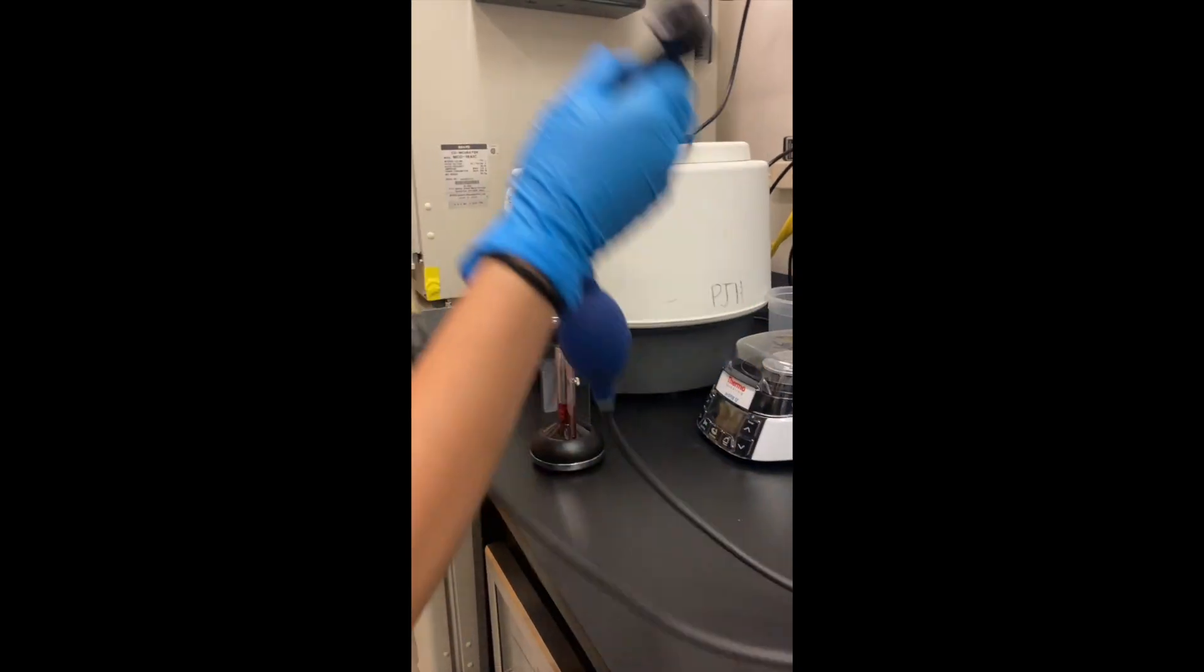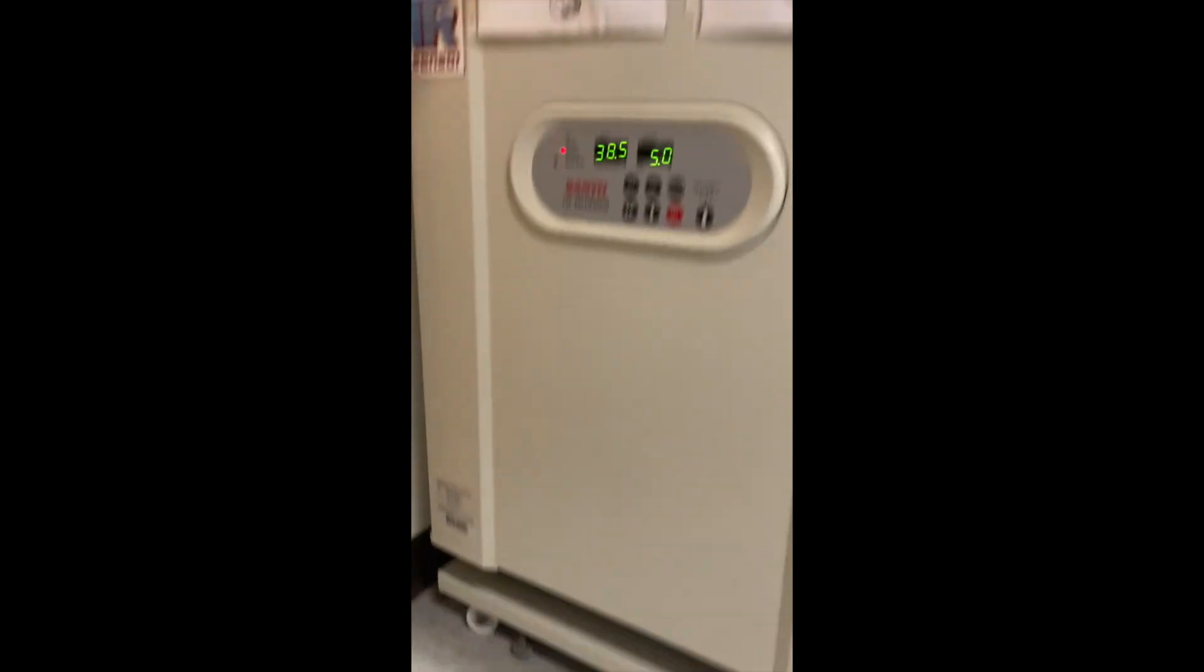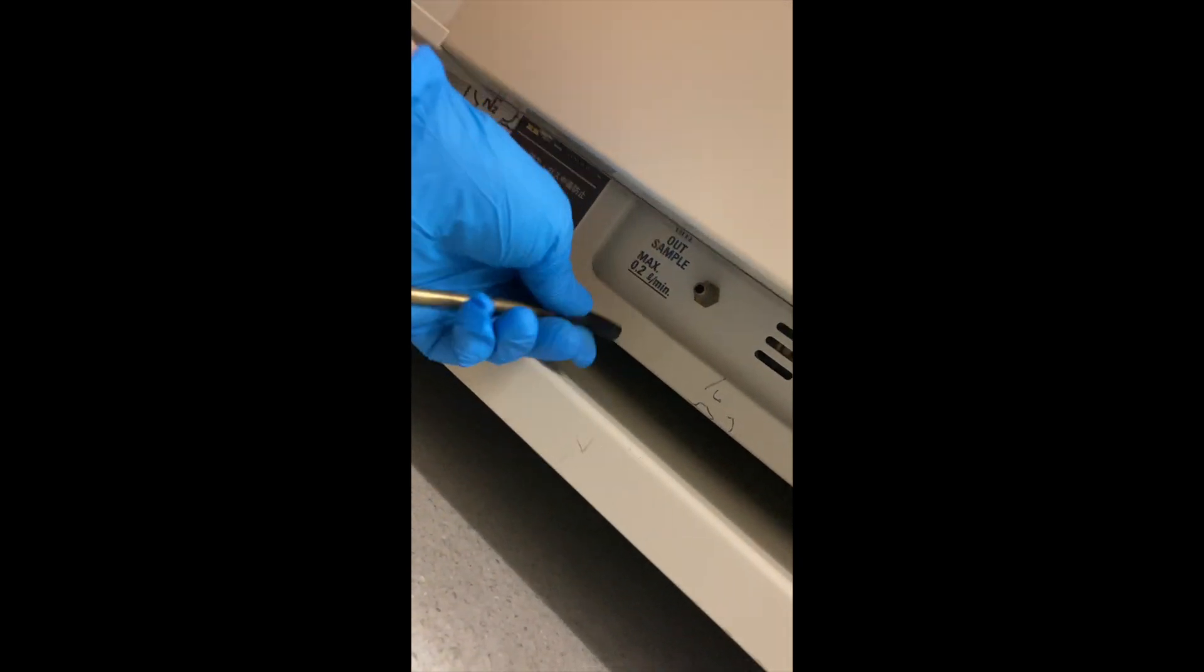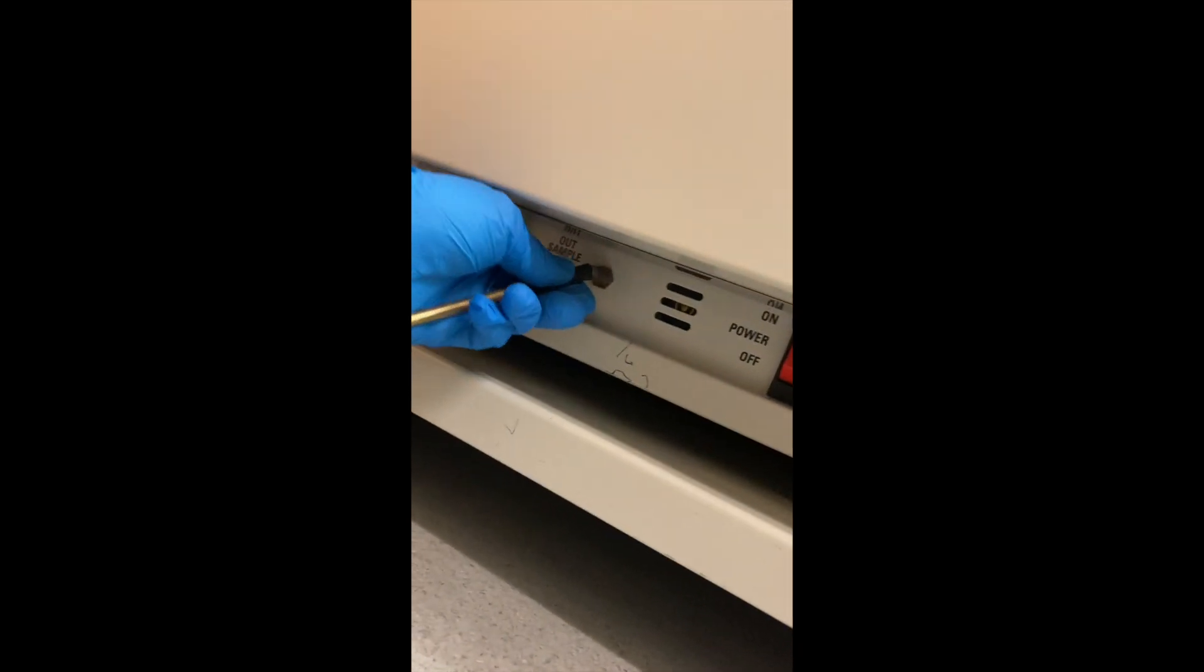And then you will see on the bottom of the incubator, you have this thing. So you basically just connect.